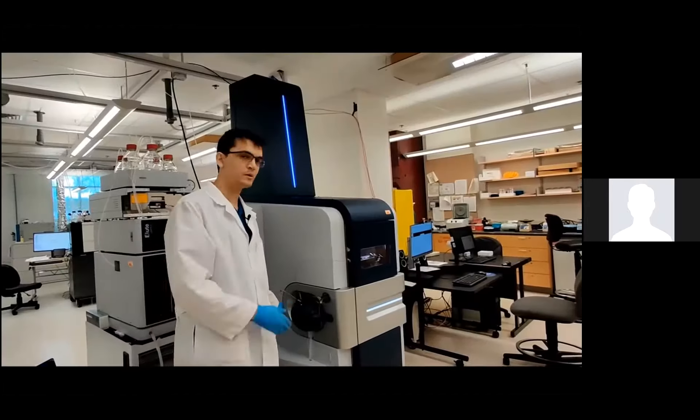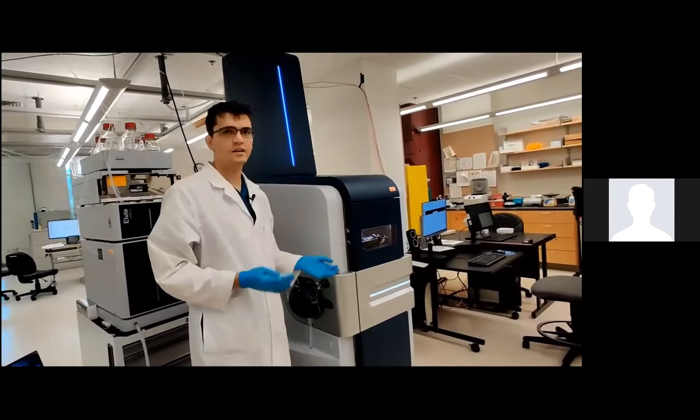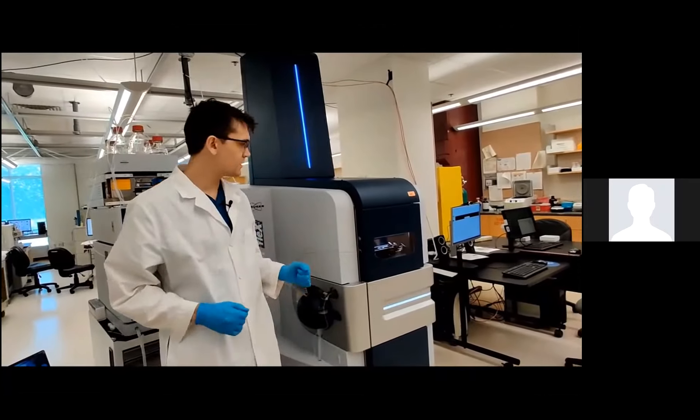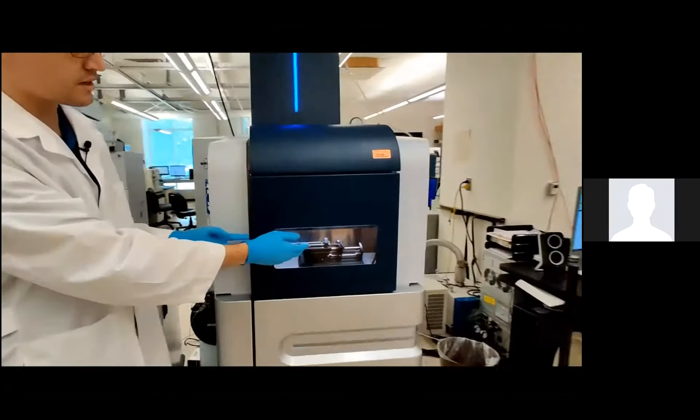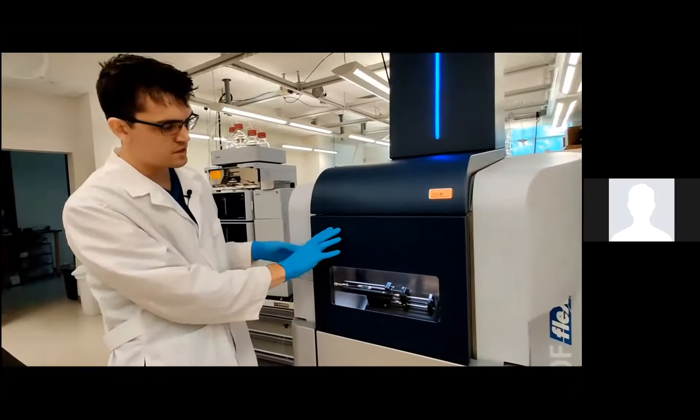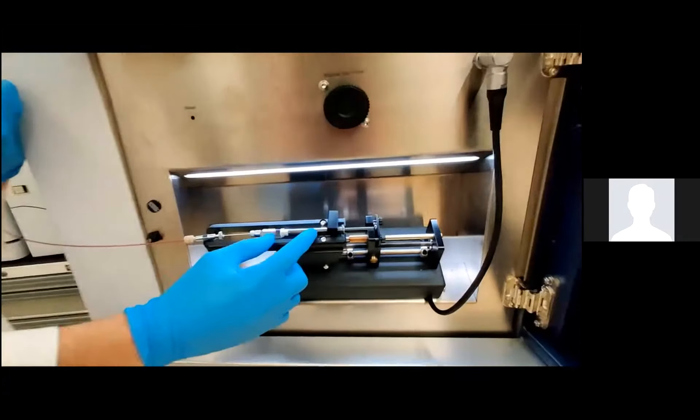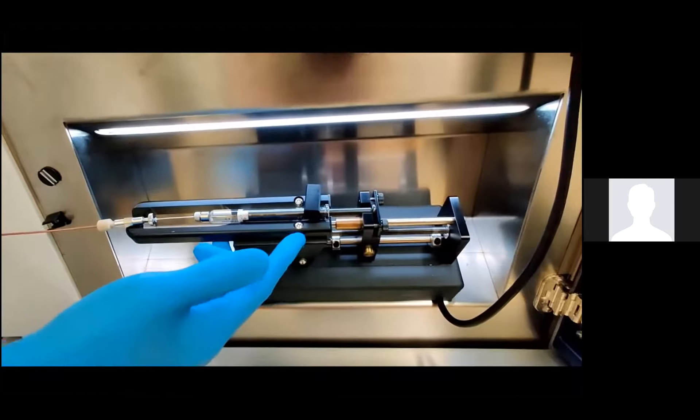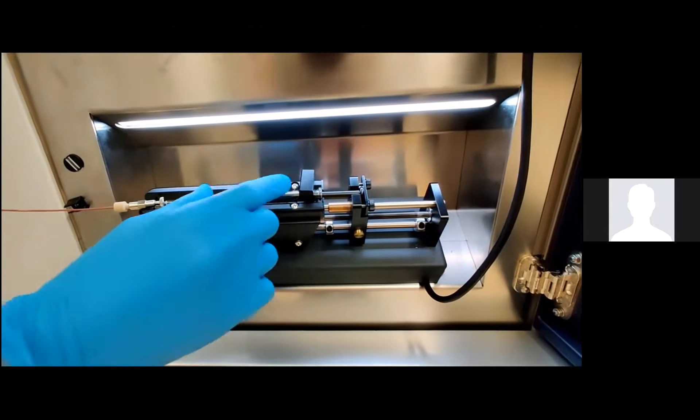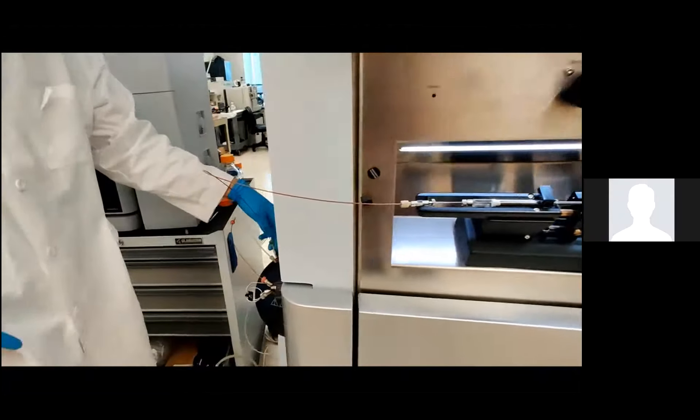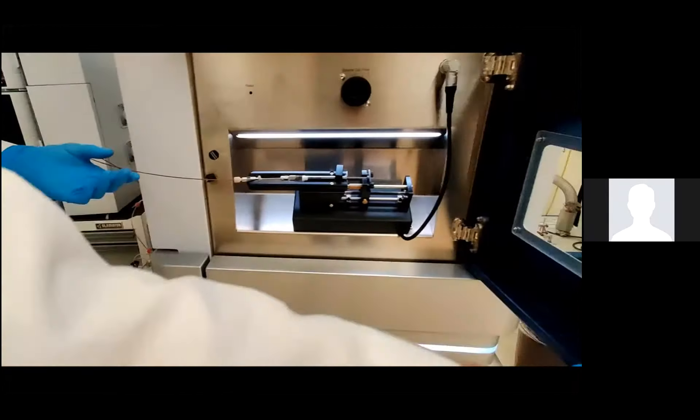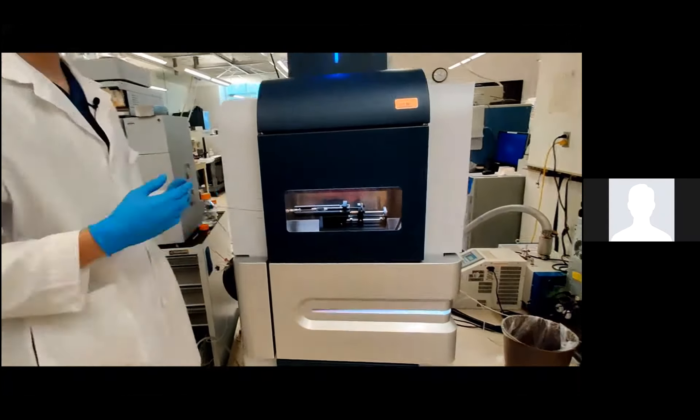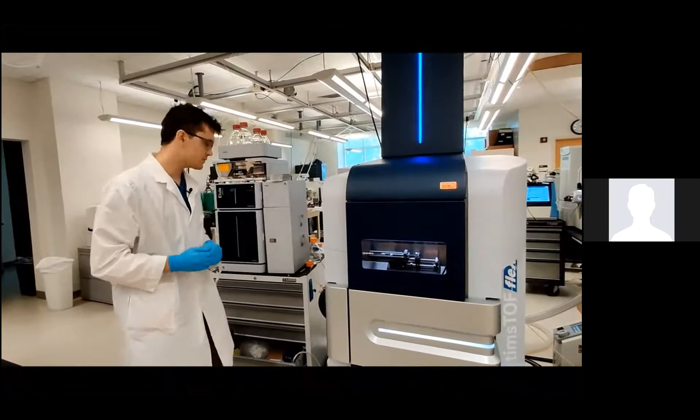So we have this little microscope here, which we can put over the tip and look through. Now that I've put the ESI source back together and the needle back in, I can actually start calibrating the Timstof. So here in this direct infusion syringe, I actually have tune mix and sodium formate. And I'll explain in a minute what they do. But this is then ducted directly into the ESI needle, as in direct infusion. And I'll go on the computer to explain how I actually do the calibration from there.